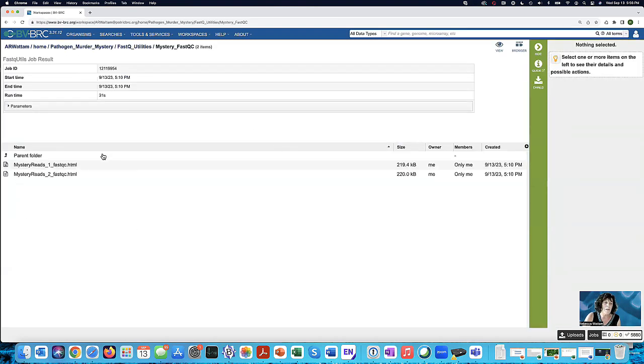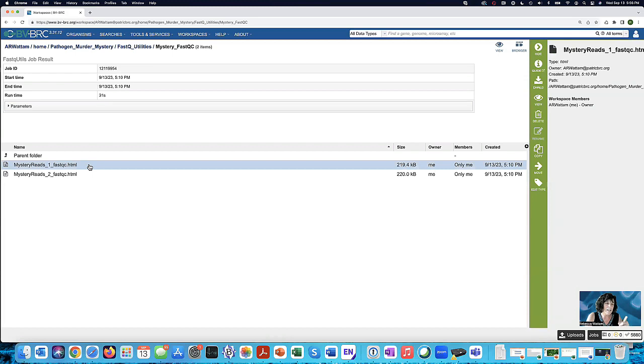And these are the job results. It's also telling me what the job ID is, and how long it took to run: 31 seconds. And these are the files for one of the reads and the other of the paired end that are both trying to sequence the same piece of DNA, toward each other. So let's look at that. So here's read one. So I click on this and notice once again, when I click on it, the green action bar gets highlighted with possible downstream actions, and we want to view this.